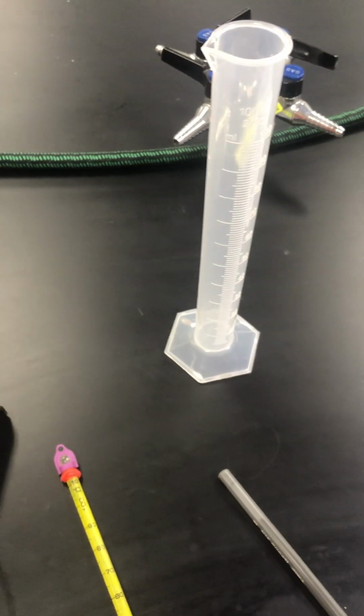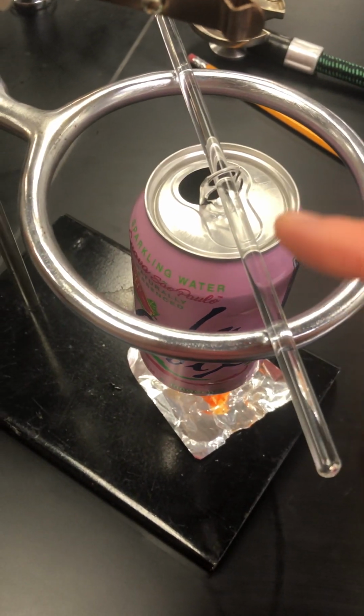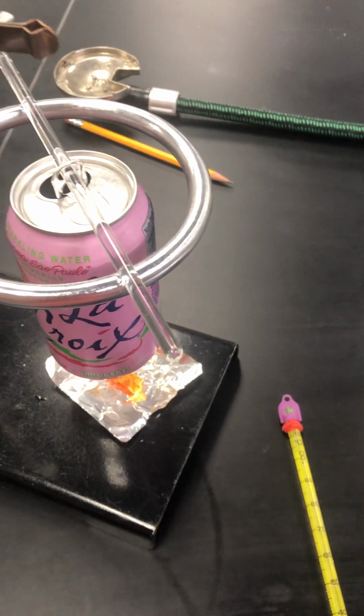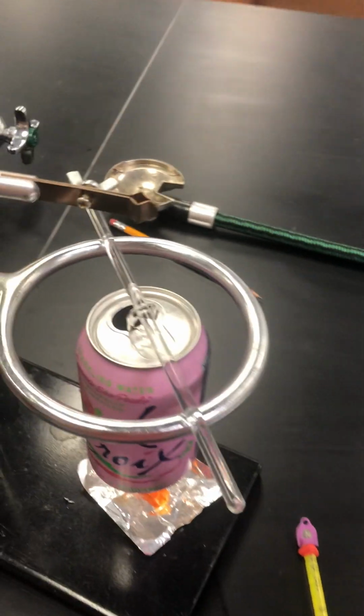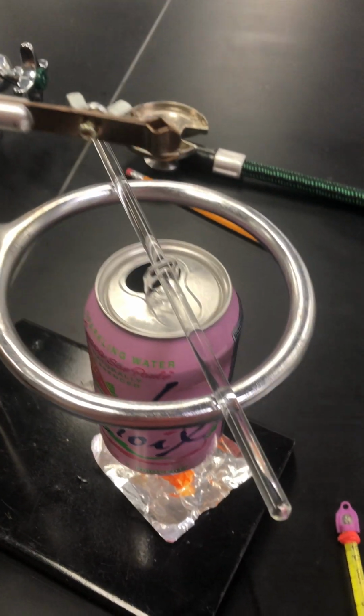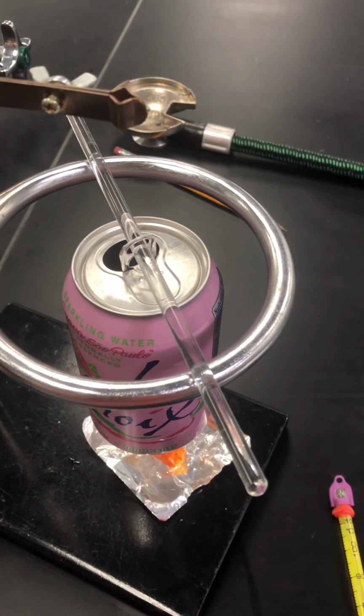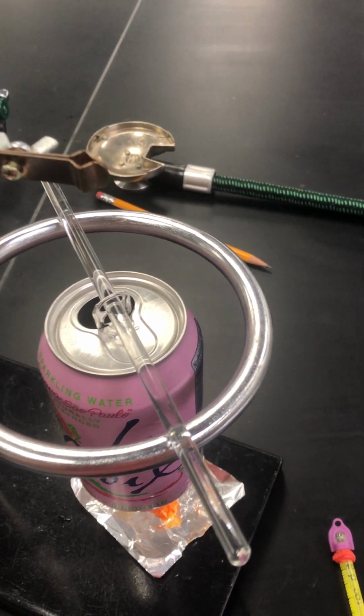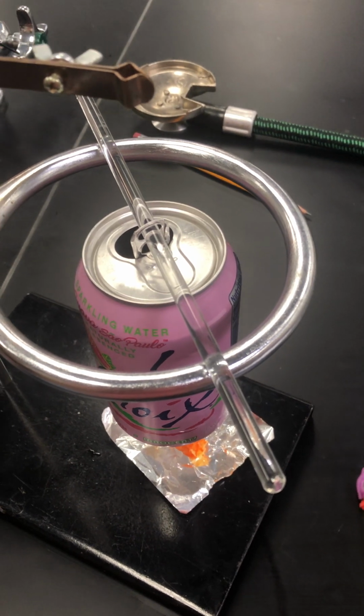All right. And we also need, well, let me get to that in a second, okay? Then it asks you to put 50 milliliters of water in our calorimeter, which I've already done. And also, before doing this lab activity, you're supposed to read the lab background. So if you haven't already read the lab background, go ahead and pause this video, go read the lab background, and make sure that you've taken notes on the vocab for that. There's 5 terms that I wanted you to define from that lab background. And if you've paused the video and you're back, let's get going.